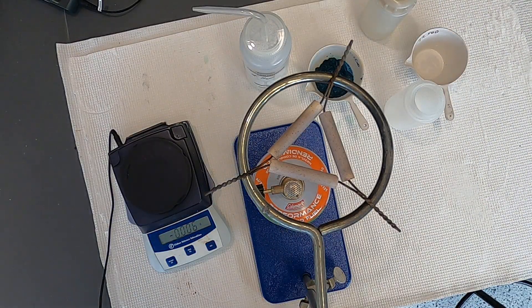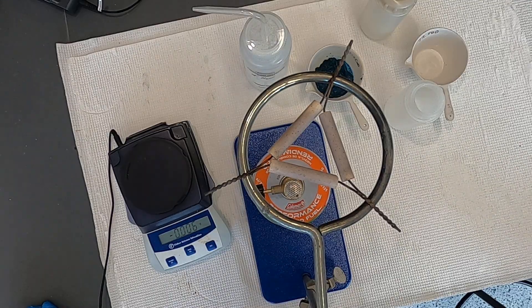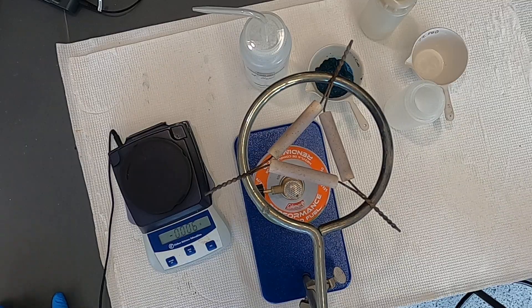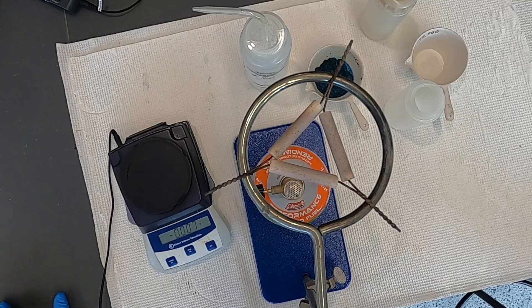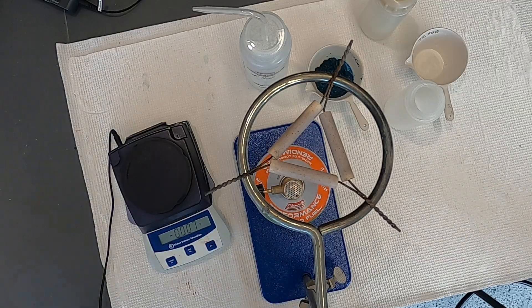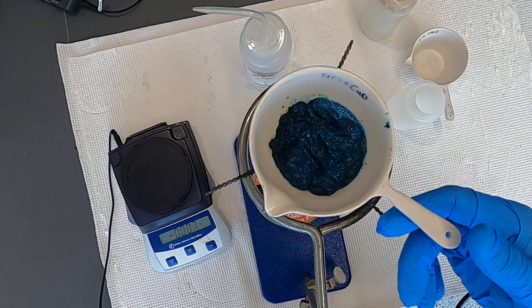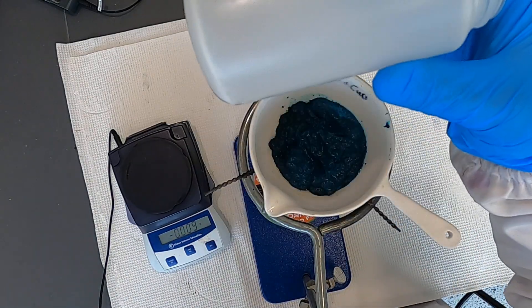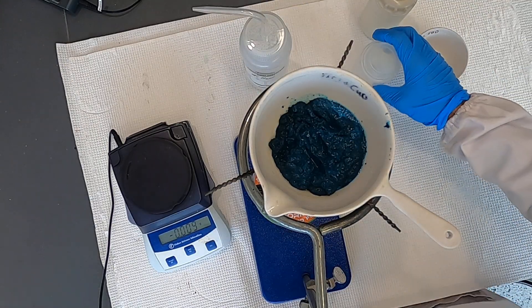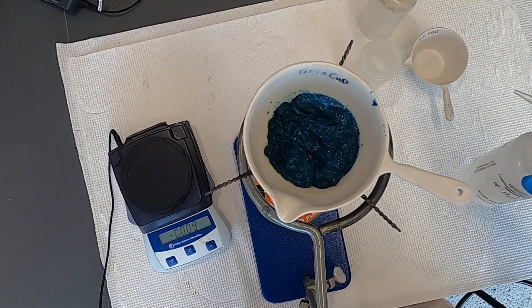Welcome back to the final portion of the synthesis of copper oxide from copper sulfate pentahydrate. In the last videos we went ahead and isolated the solid copper hydroxide, and this is what it looks like. It was an arduous task to remove from this bottle here — I did that by scraping it out and then used some water to rinse it all.